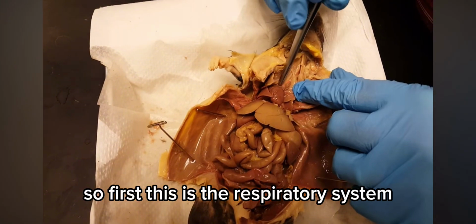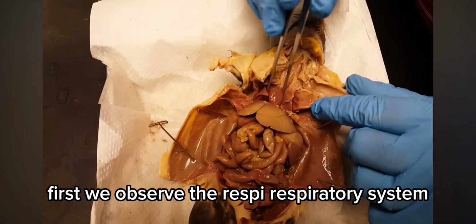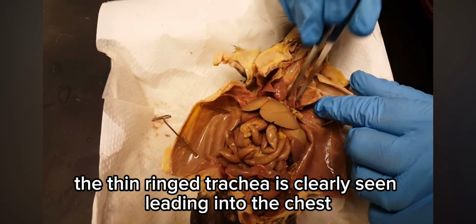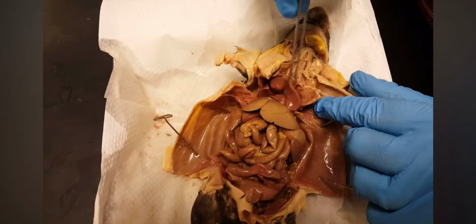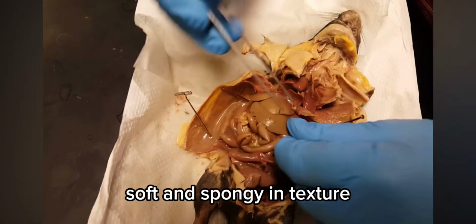First, we observe the respiratory system. When the thoracic cavity is open, the thin ringed trachea is clearly seen leading into the chest. On both sides of the cavity, we find the lungs, soft and spongy in texture.